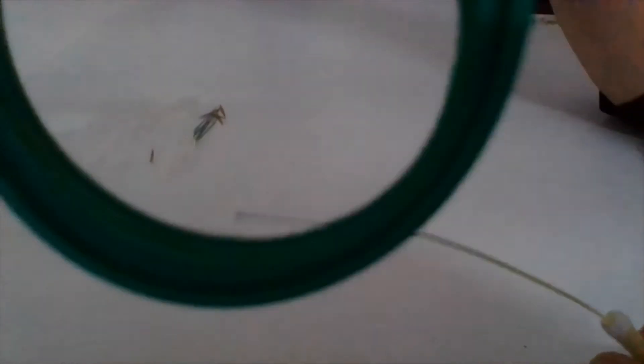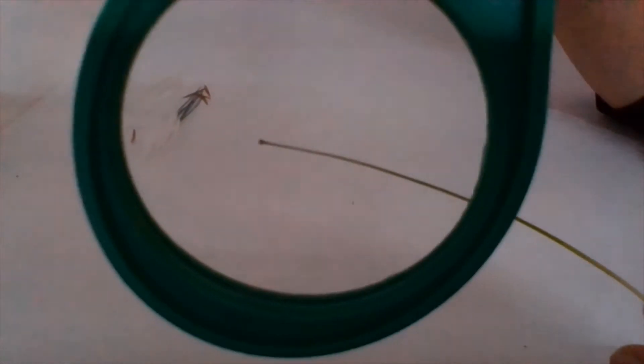The stigma is something very essential for reproduction because it helps in grabbing the pollens very easily. For this purpose it is very feathery and very sticky, so the pollens can easily become stuck here. As you can see it is a little broader at the top — you may not be able to see it being feathery or sticky, but it is like that. That was about the stigma.